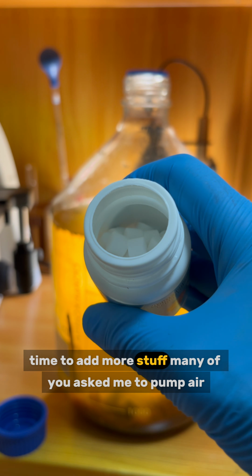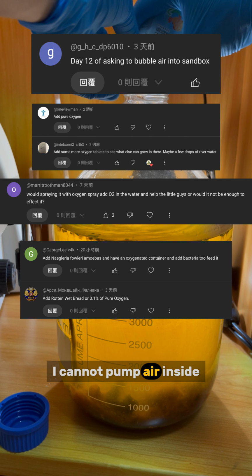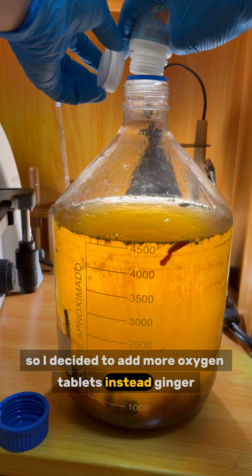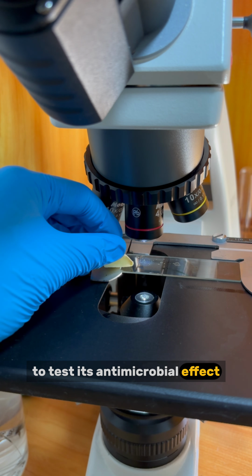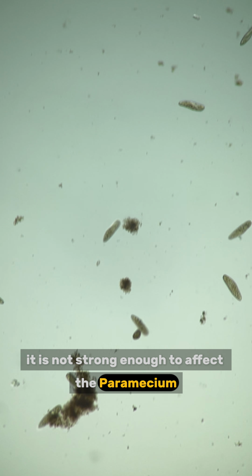Time to add more stuff? Many of you asked me to pump air. I cannot pump air inside, so I decided to add more oxygen tablets instead. Ginger. I try to put it near the slide to test its antimicrobial effect. It seems it is not strong enough to affect the paramecia.